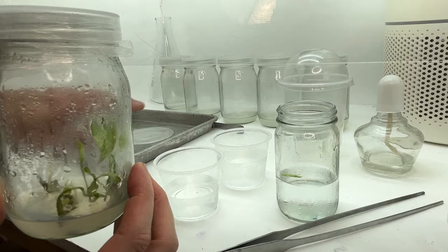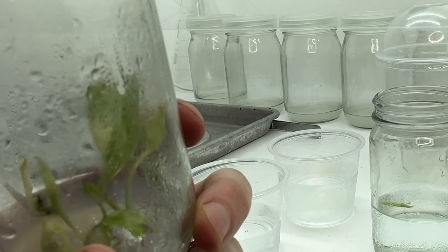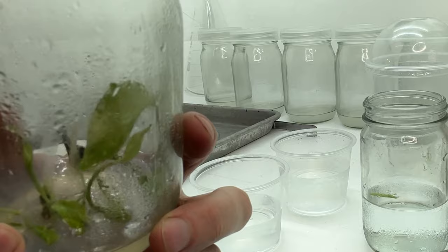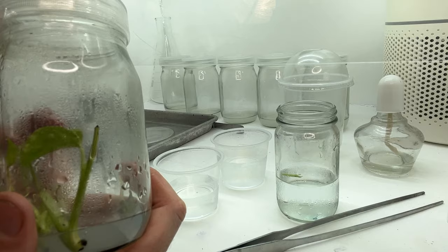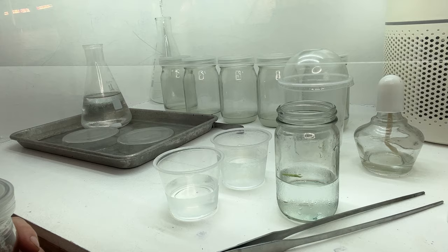Within a few weeks, your plants will begin to multiply like this. Towards the middle of this jar, you can see a Thai constellation starting to multiply — you can see the multiple shoots coming out of one stem. This is the beauty of tissue culture: it has the ability to grow many plants just from a single piece of a stem. That's driven by the multiplication media having a plant hormone in it that helps cell division and speeds up the branching process of the plant.